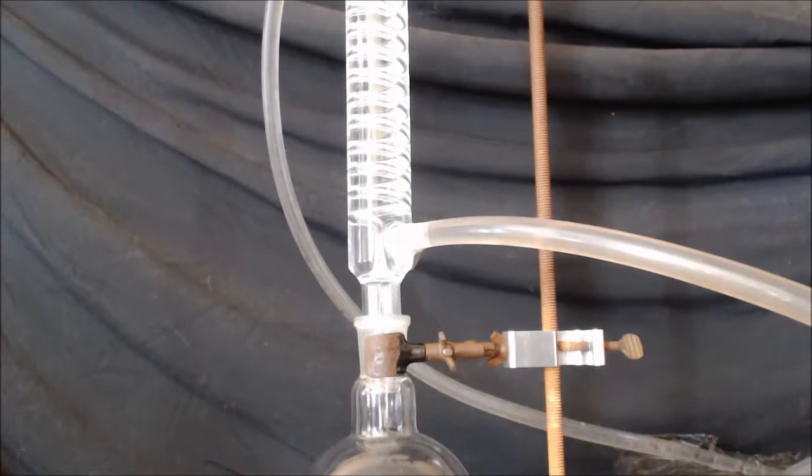And then I added about a milliliter of methanol to this pot after it cooled down, because I did add extra dichromate and I wanted to neutralize that. Now I'm going to set up for distillation to get out my formic acid azeotrope.